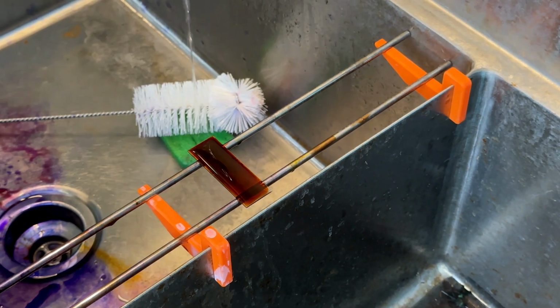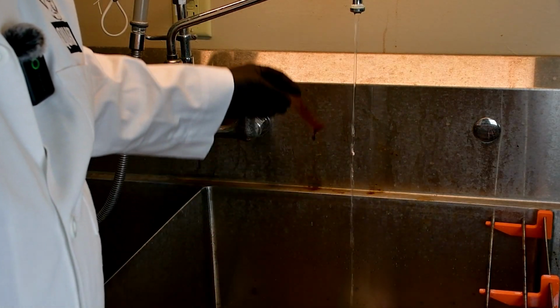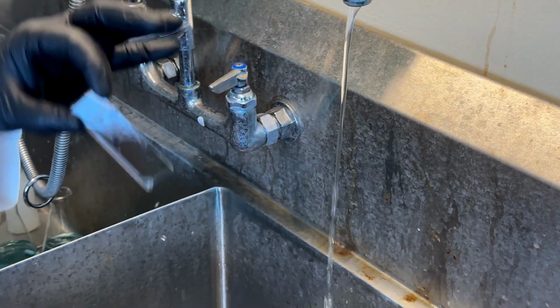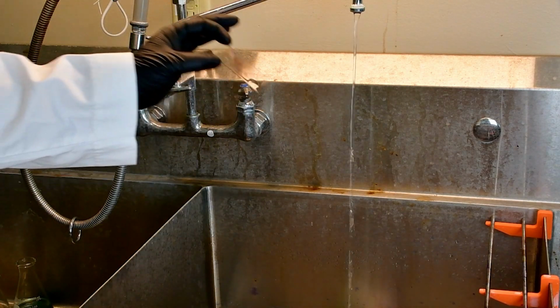So once that's fully covered, I'm going to start my timer, and that's going to stay on for 1 whole minute. Alarm goes off. I'm going to wash the slide off as we've seen a few times already. And the Neisser stain is already complete. This one's much easier than some of the other ones that we've done. I'm going to set this aside, let it dry, and once it's dry completely, we're ready to look at it under the microscope.